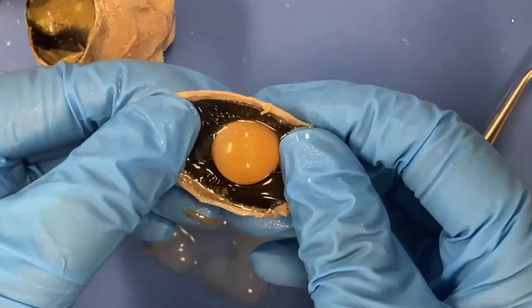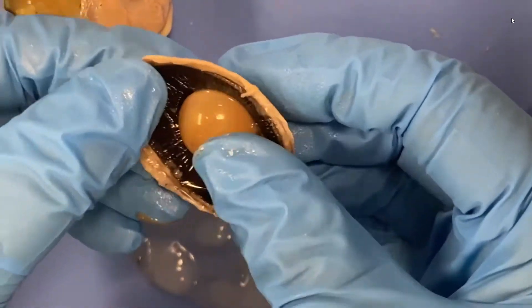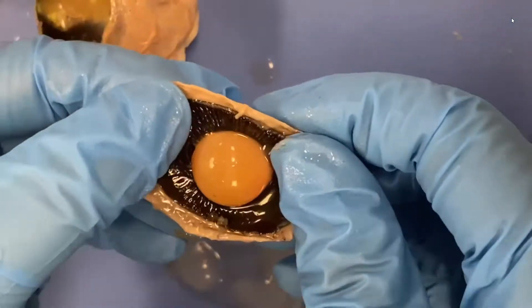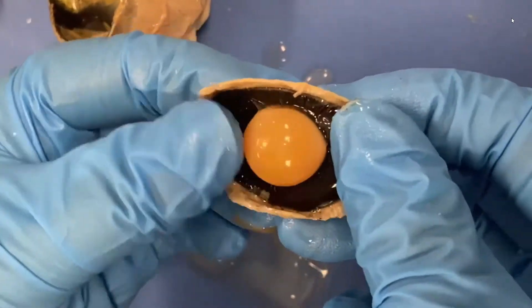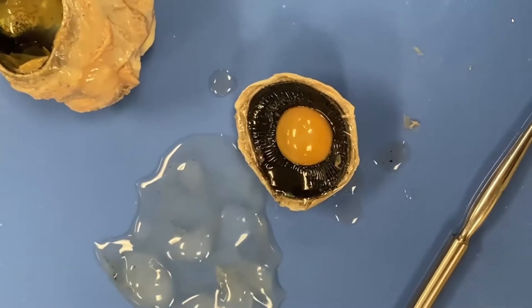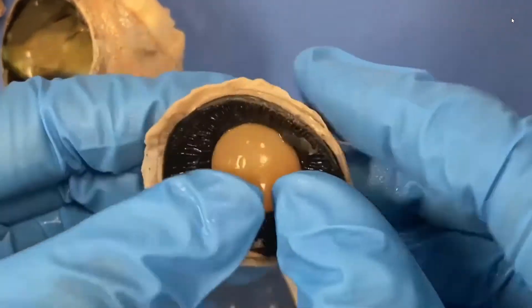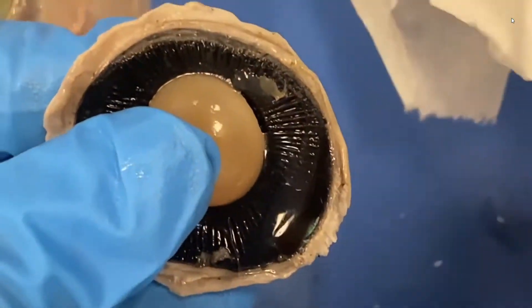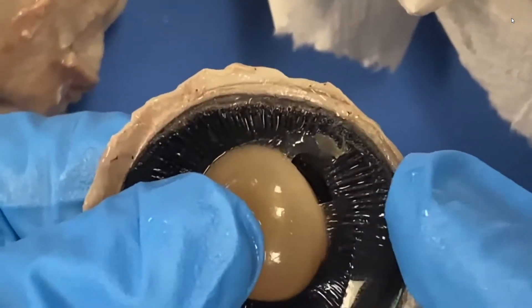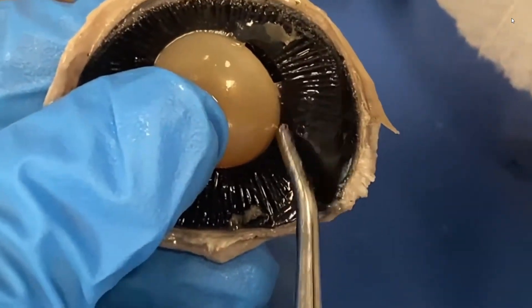So if you look right here at the lens, we might get a vision of what the suspensory ligaments look like. They're really hard to see, and they're crystal clear — let's see if we can see them. I need a paper towel just to soak up some of this moisture to get a good view. So if we pull that lens apart, sometimes you'll see the little... there they are. You'll probably miss them — I'll probably rip them — but I'm going to flip it forward, and you'll see these little tiny clearish-looking ligaments right there when I pull it apart.